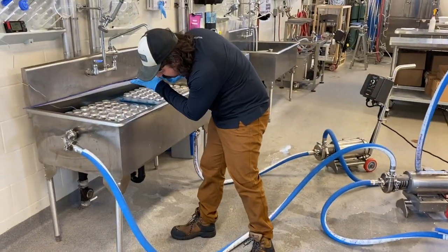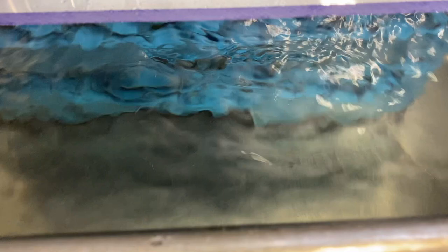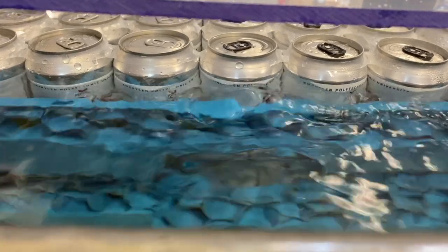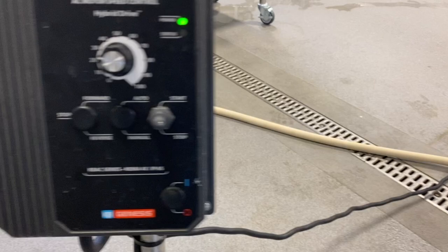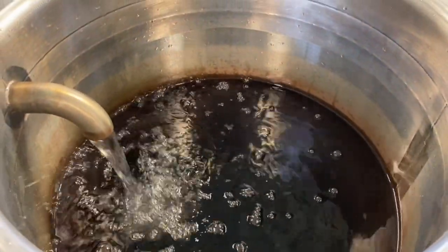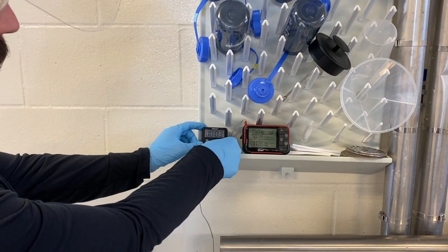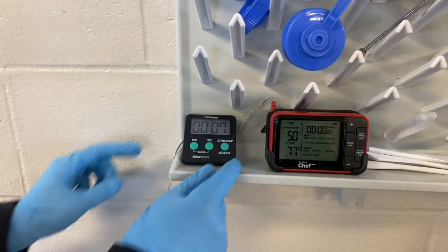Check the water flow and the water level in the sink. Use the CIP pumps to regulate the water flow rate. Once the can temperature reaches 50 degrees Celsius, start the timer and start recording the time-temperature data.